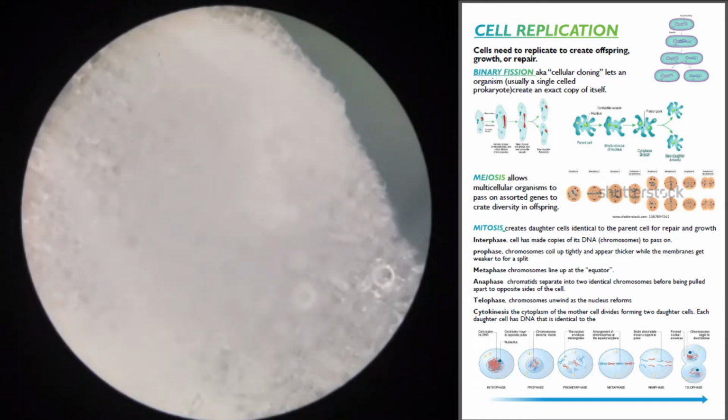I can see the blue creeping. Put that back somewhere safe. Whew, I didn't get any methylene blue on my fingers. That's awesome. I like that.